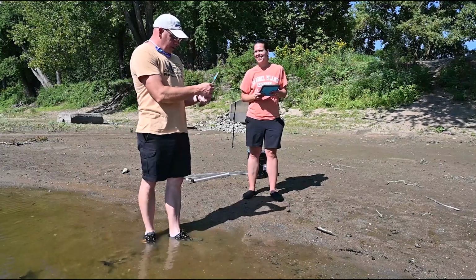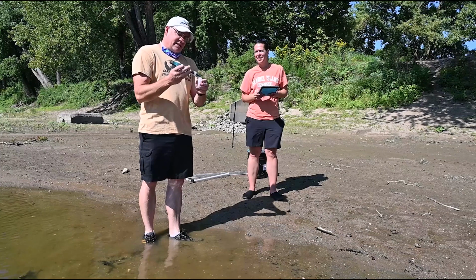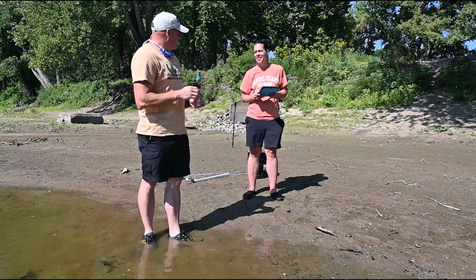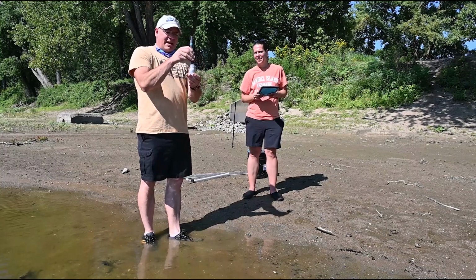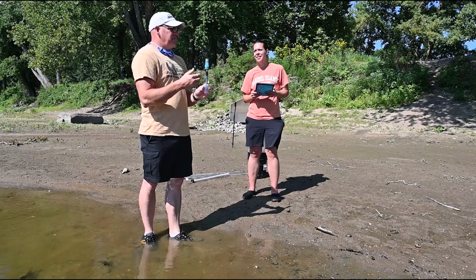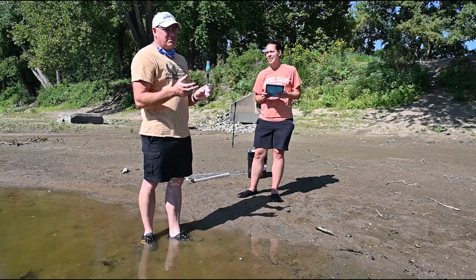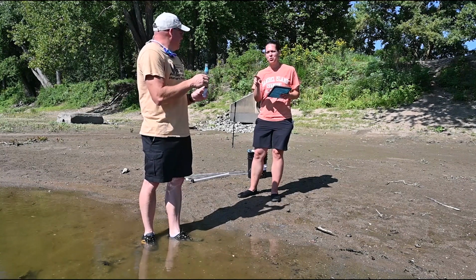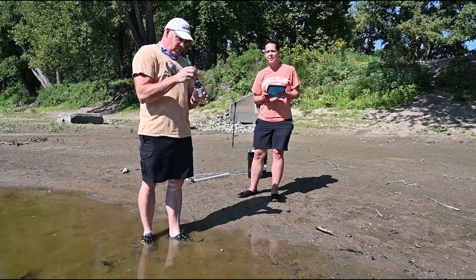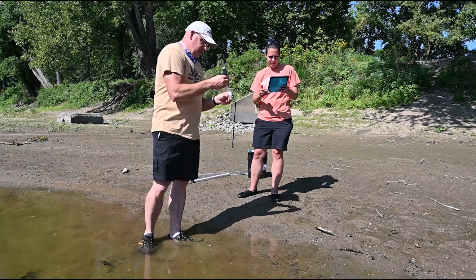Now we're going to test pH. We have to be careful with these because there's a glass bulb on the bottom, so we have to be careful not to hit anything. Some people have asked what that is in. This is what we call a buffer solution. That's so the bulb knows this is a 7, or sometimes it's higher or lower. I think this buffer solution holds at about a 4. It's a buffer solution, so we don't want to pour that out and contaminate anything. I'll drip that out real fast so all that's out.